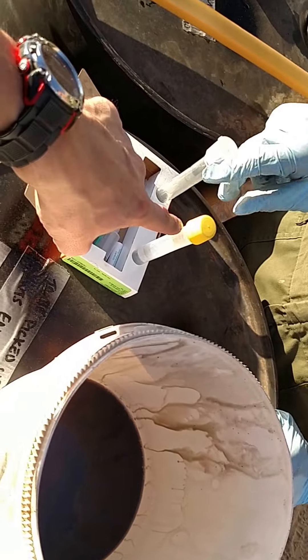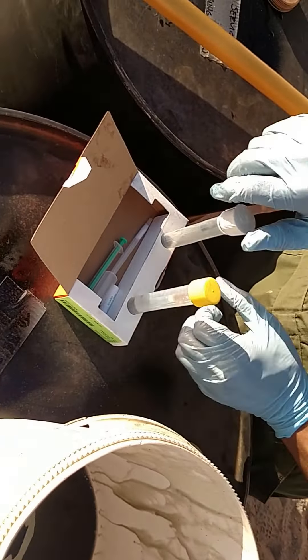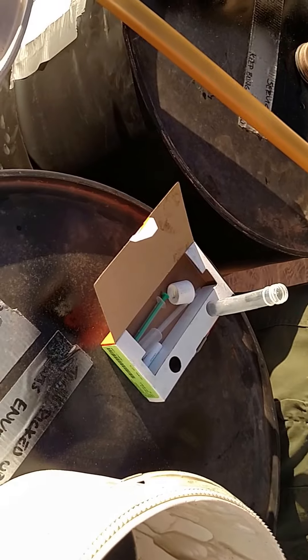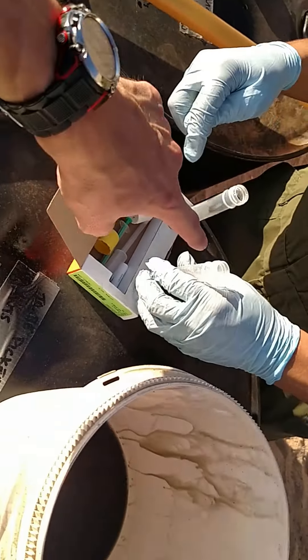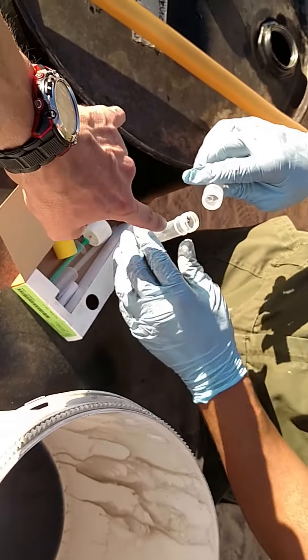Take the yellow cap off of that and the white cap off of that. Then pour the clear sulfuric acid into there — pour the clear solution, which is the sulfuric acid, into tube one.